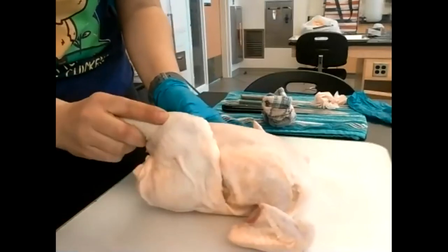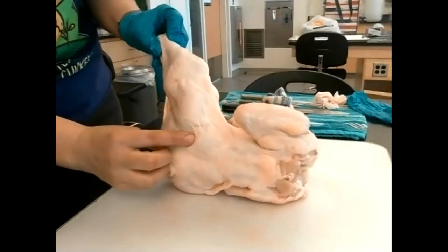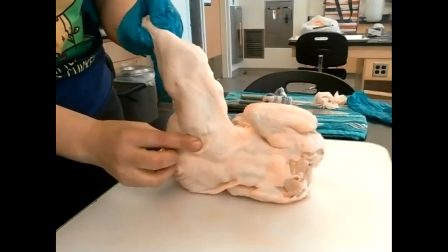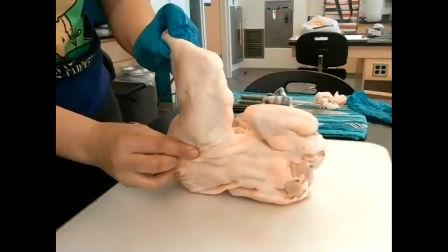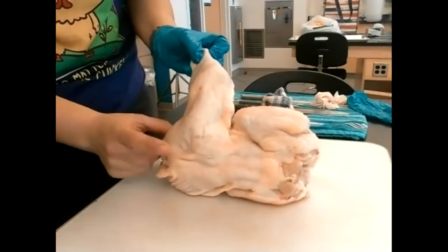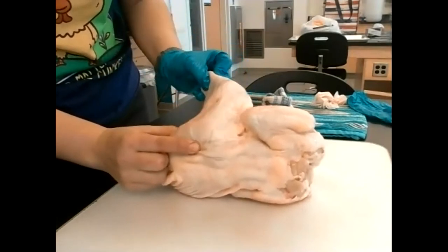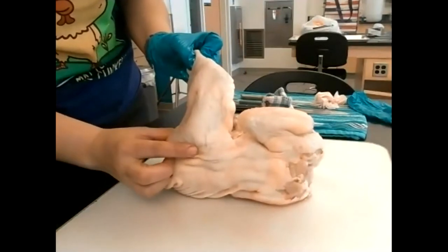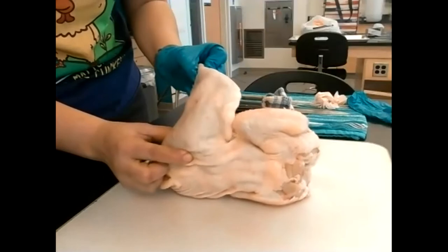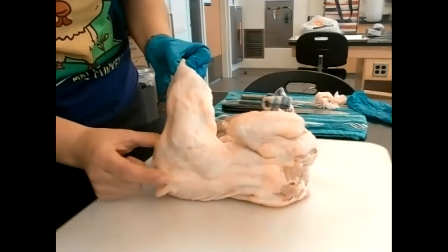The leg is moving at the joint. The hip, which is right over here, is a ball and socket joint — this allows the chicken to bend forward, run, or put its legs out to the side. The ball and socket joint allows for the most mobility of any of the synovial joints. I'm feeling the femur — specifically the greater trochanter — moving around, while the pelvis isn't moving at all.